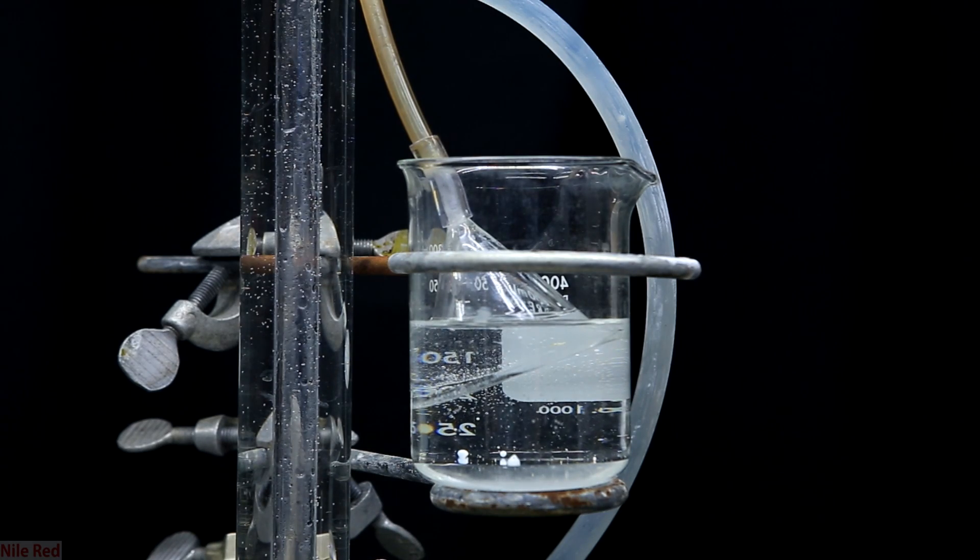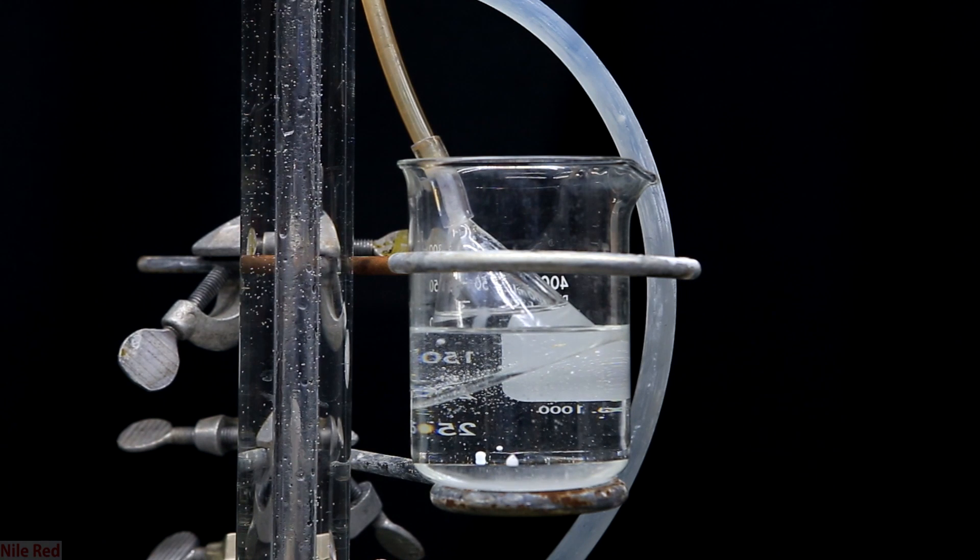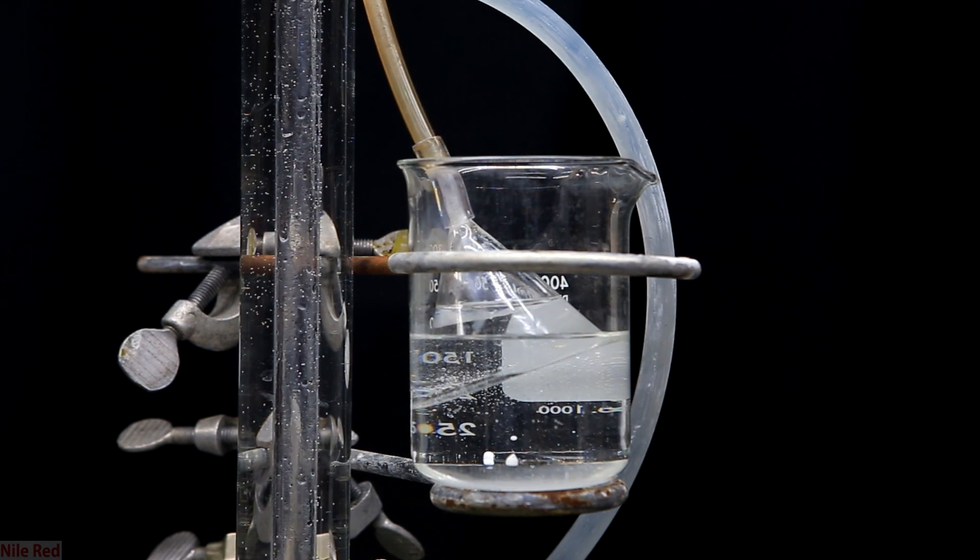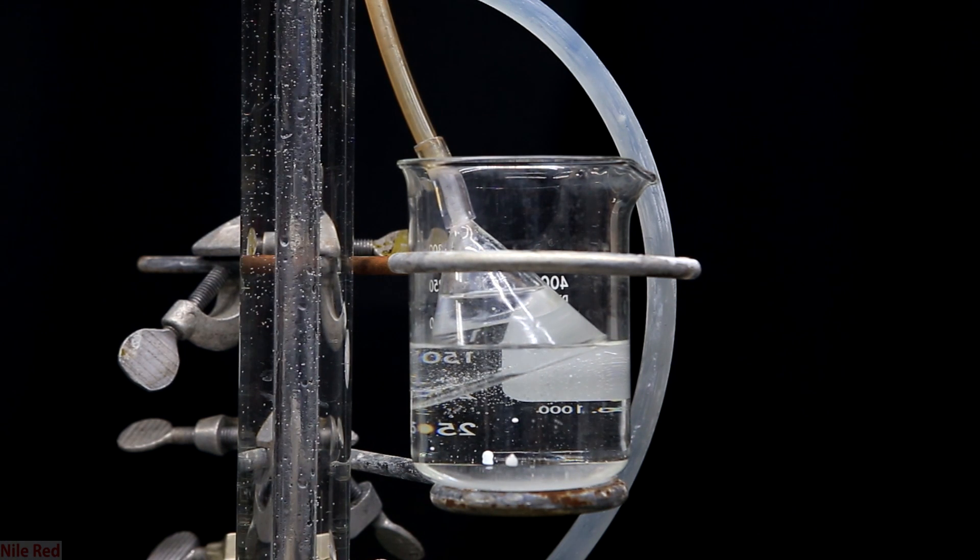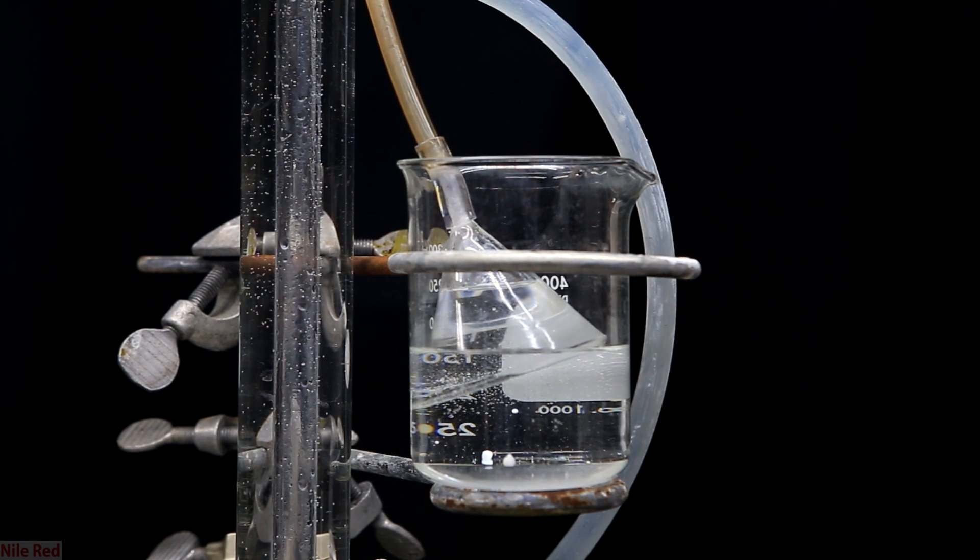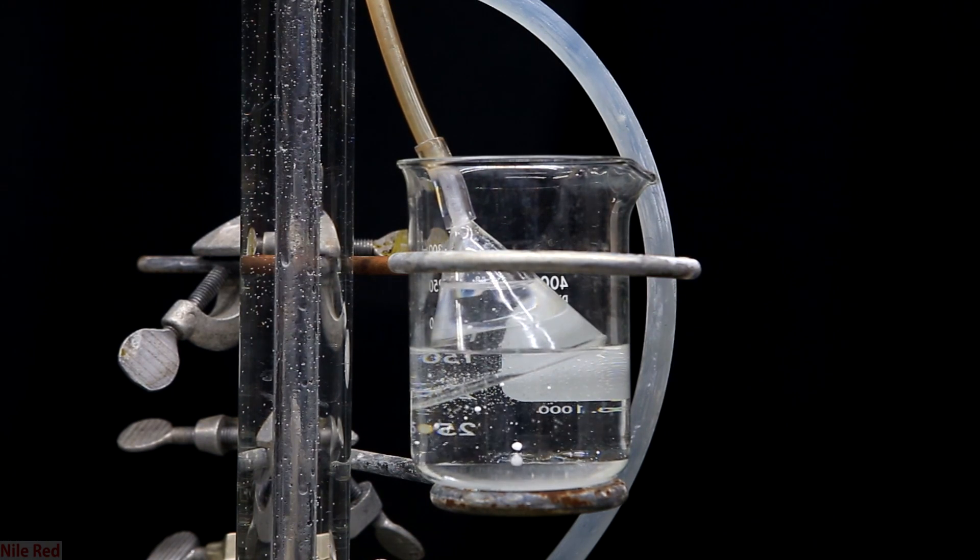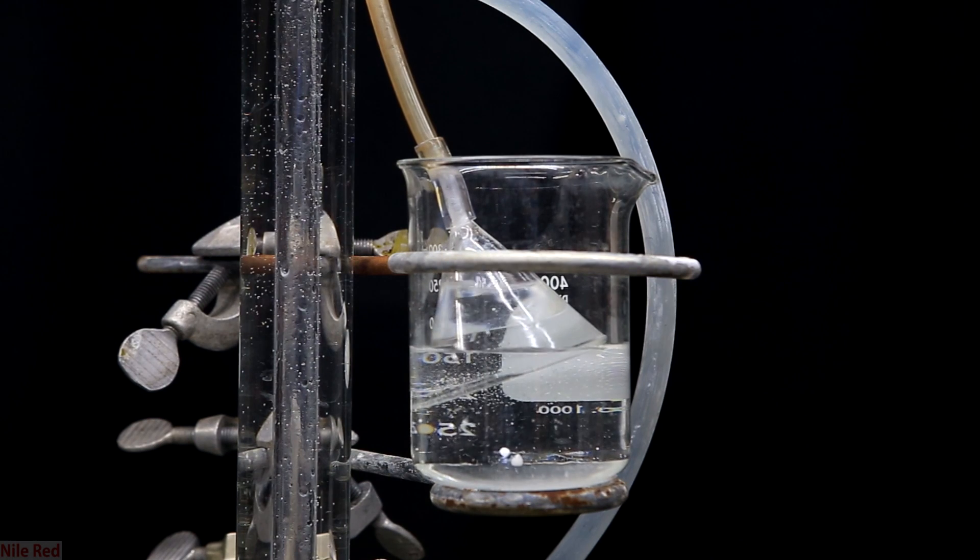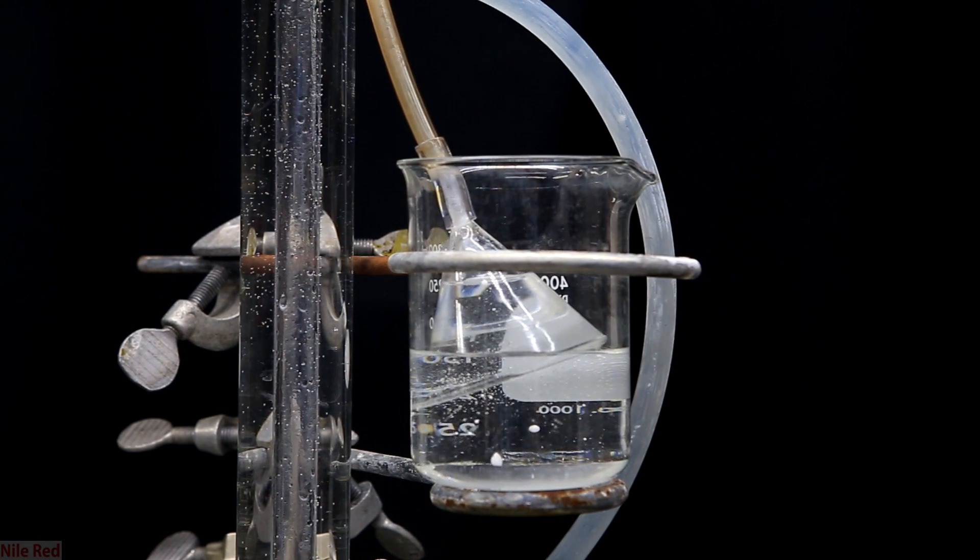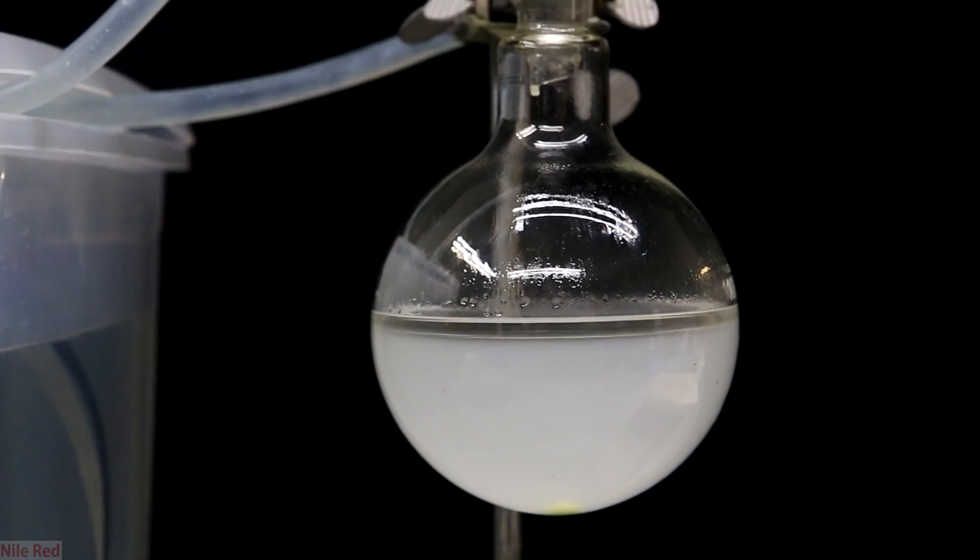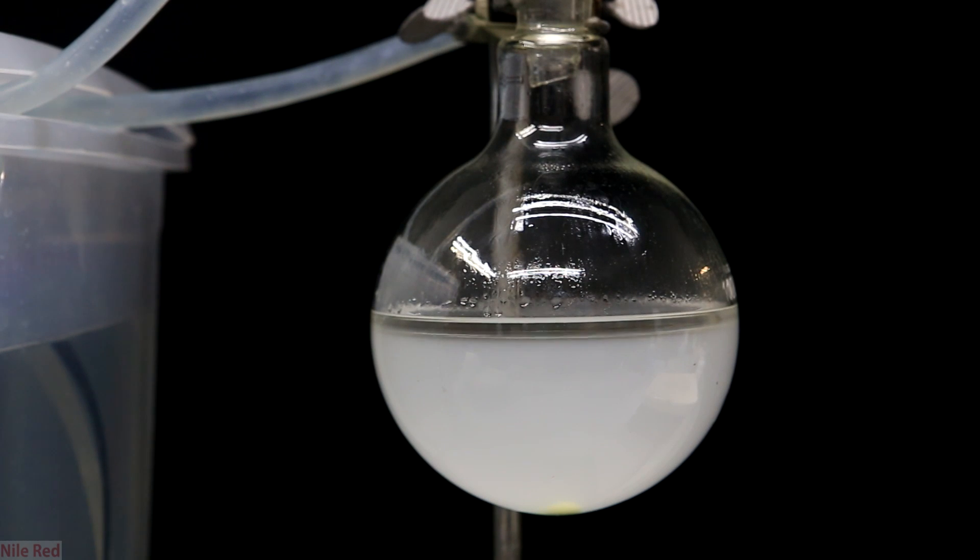The purpose of the inverted funnel is illustrated here. Our apparatus is a closed system and as it cools down the air will contract and pull a slight vacuum. This will pull water from our trap into our apparatus. With the inverted funnel you can see that it does suck back up but the water never makes it to the tubing. If we used just a tube and no inverted funnel, water would be sucked very easily back into our apparatus and into our reaction flask. As the flask cools you can see a layer forming on the top and this is the product benzyl chloride.